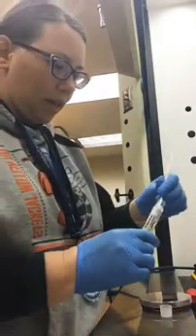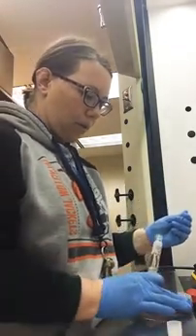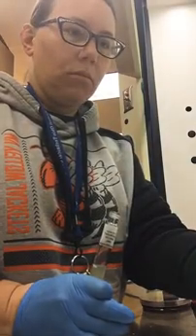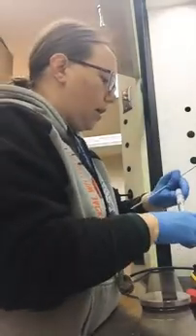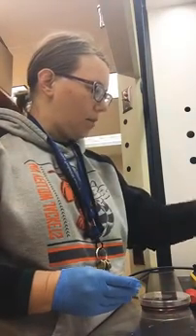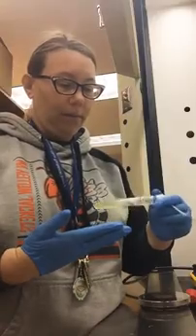Flip my plate over so I can lift the lid, get a transfer. When you transfer this onto your plate, you can just do a simple streak. You don't have to put a lot down because you've divided the plate into 3 sections. You don't have a lot of space. Just a simple streak will do. Because I'm doing a demonstration plate, I'm actually transferring my K. rhizo down and making the little symbol because I'm clever like that. So when I put my S. epi down, I actually made that little fishy symbol, again just to remind me the type of hemolysis we're expecting.